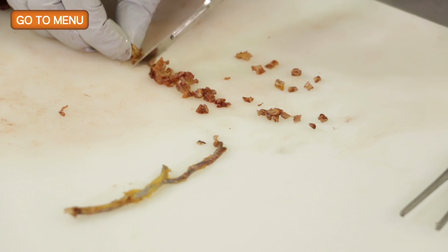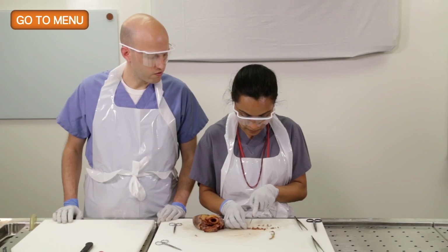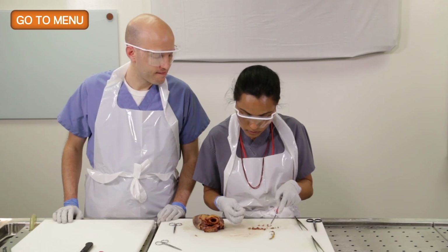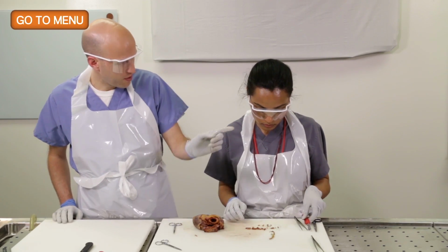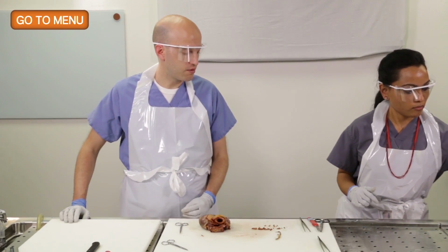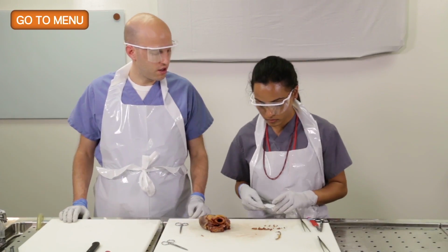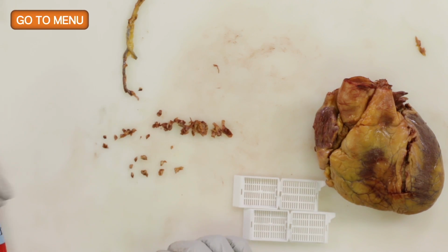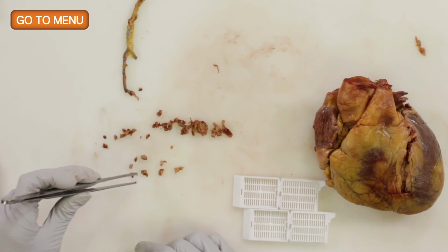And so what do you think about the amount of stenosis in those vessels? Again, I would say mild. All right. So if you want, we have some cassettes over there. Let's take a representative section, or the most stenotic section of both the circumflex and LAD, and put them in a cassette so that we know.